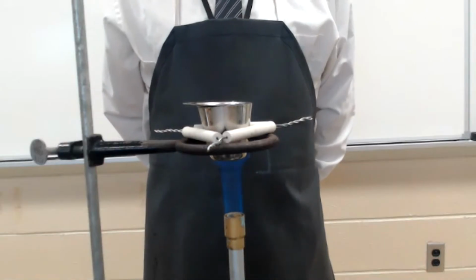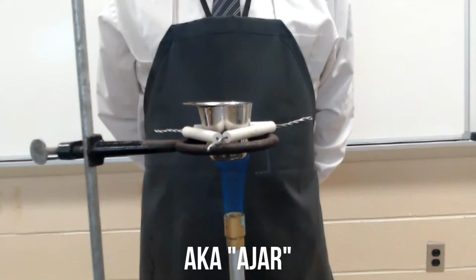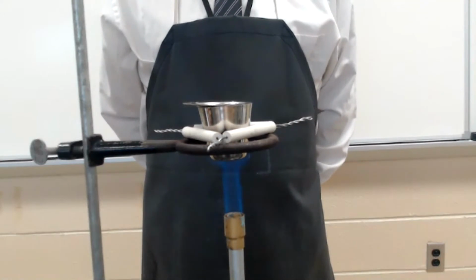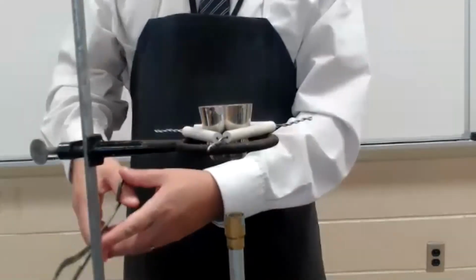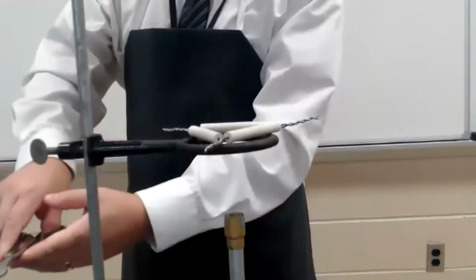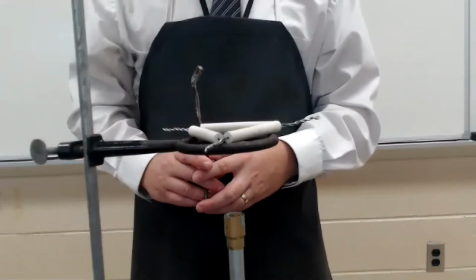Be sure to leave an opening between the crucible lid and crucible, which will allow the evaporated water to escape. When the sample is finished heating, carefully remove the crucible lid and the crucible. Allow it to cool on the base of the ring stand.